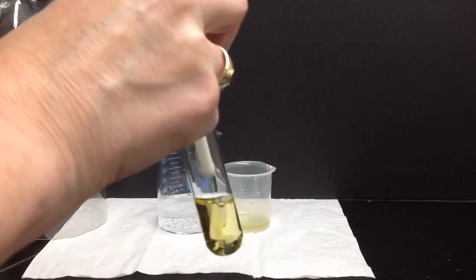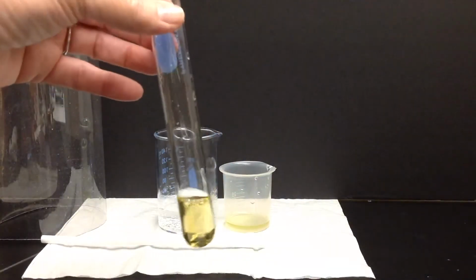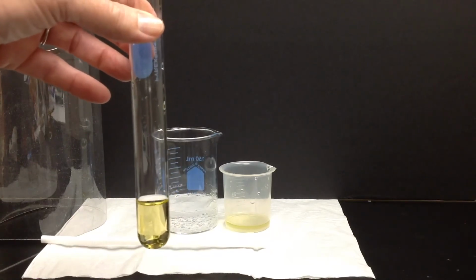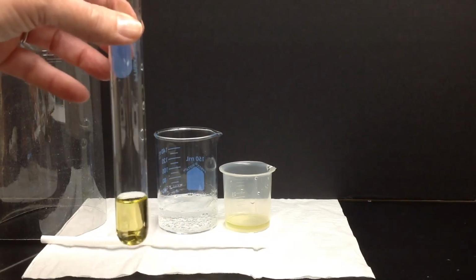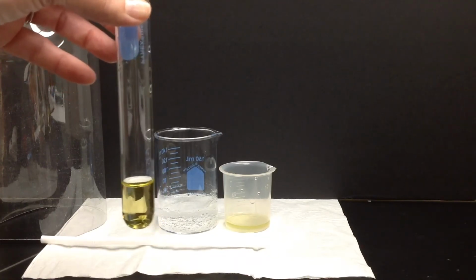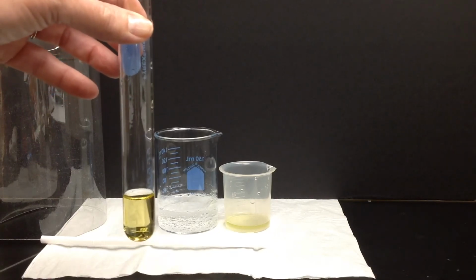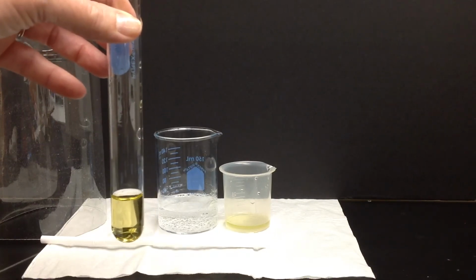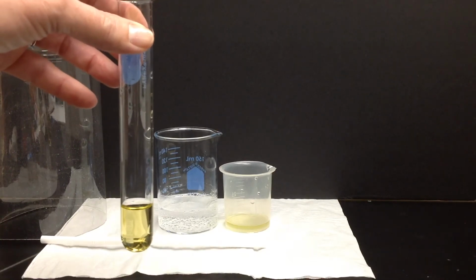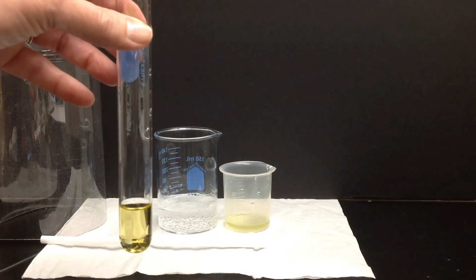Well, now, we have a second set of observations. We had the bromethymol blue, which was blue, and when I blow into it, now it turns yellow. So that second observation about bromethymol blue turning from blue to yellow, we want to be able to use that in conjunction with part one of the experiment, which is about the Alka Seltzer. So I'll put a few questions that go with this, but I'm going to stop the video now.